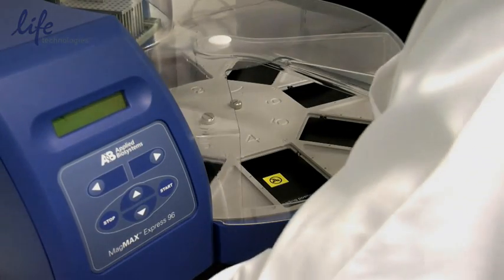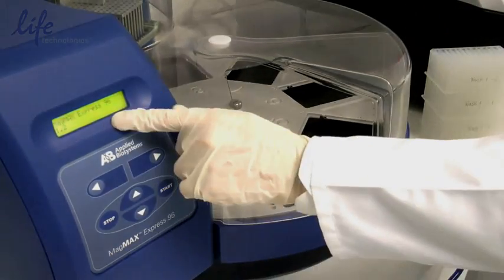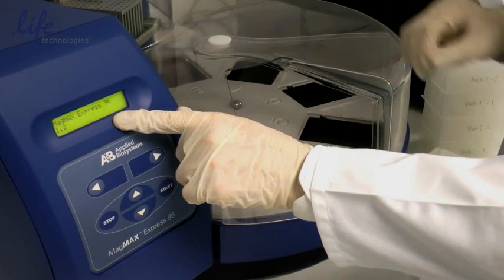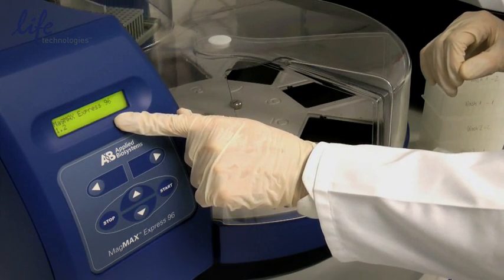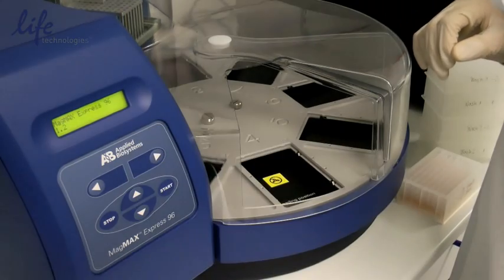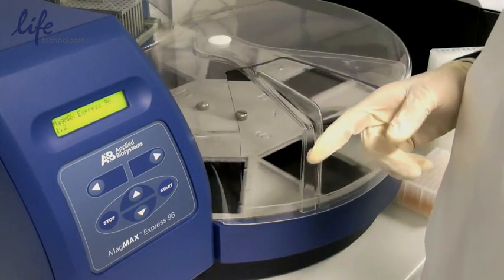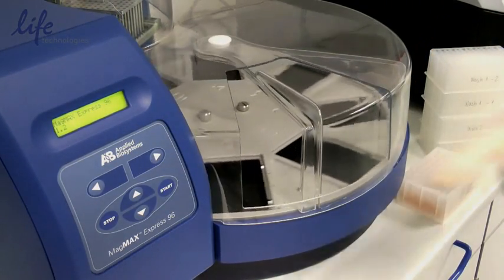Now we'll load the plates into the MagMax Express. First we'll turn it on. You can see it will make a few movements to test itself. The moment it's finally loaded it'll give us a message that everything is OK.